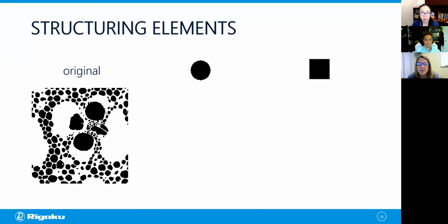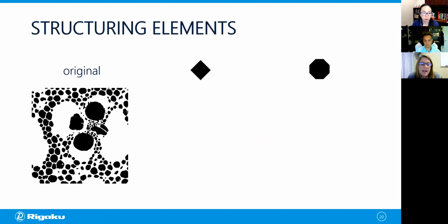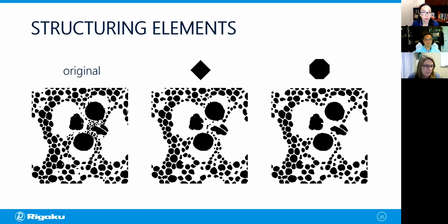So first, let's look at the circle. And here we see that many of the voids have a roundish shape similar to the original. If we look at the square, we see that now these voids look quite blocky after the opening operation. So they're less consistent in shape with the original. So how about for the diamond and octagon structuring elements? So here's the result of opening for those.